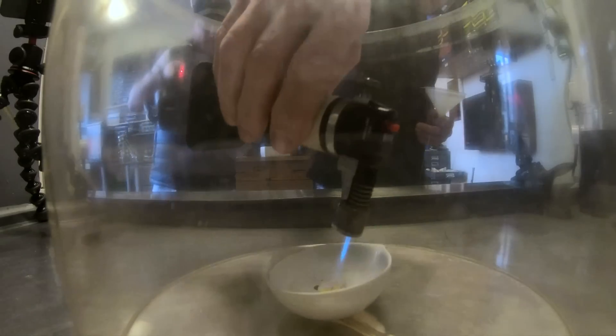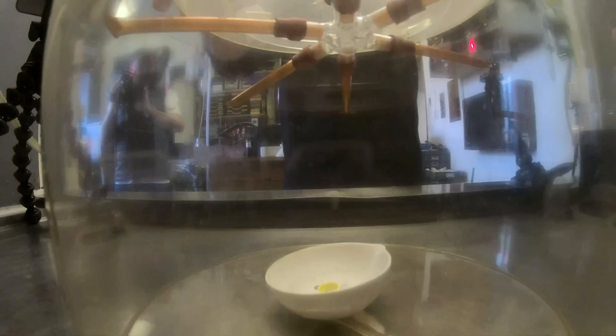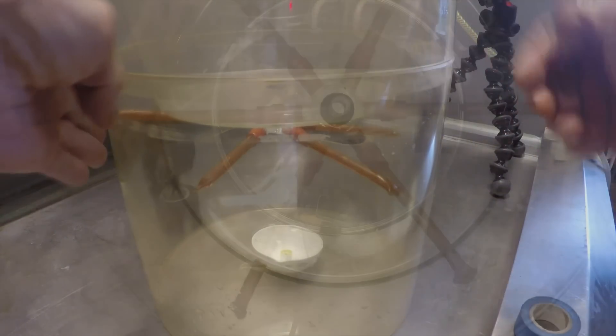Today we're going to show you acid rain. This used to be a huge environmental problem and we're going to demonstrate it to you in the lab. We're going to do it with a piece of kit which I inherited from my late friend David Jones. We got the kit but not the instructions, but Neil worked out how to use it.